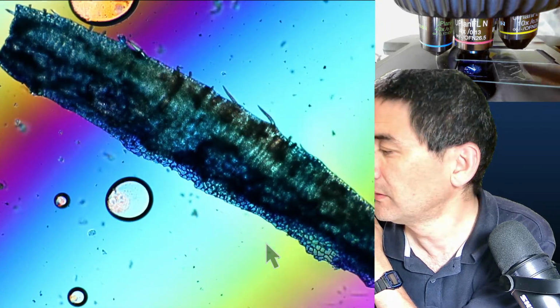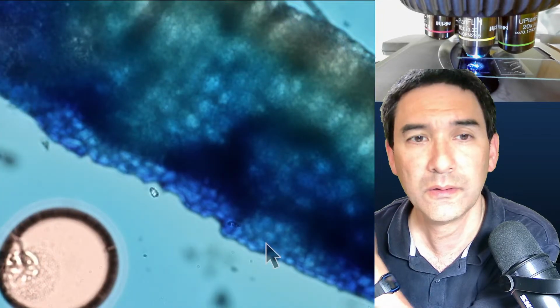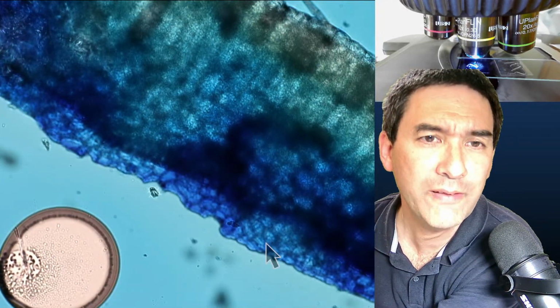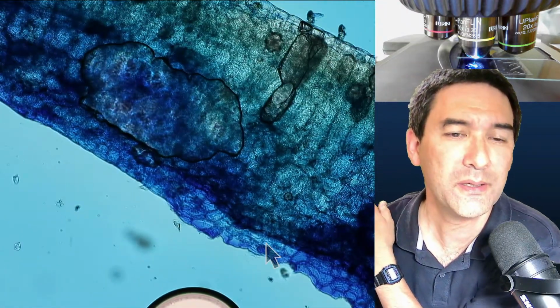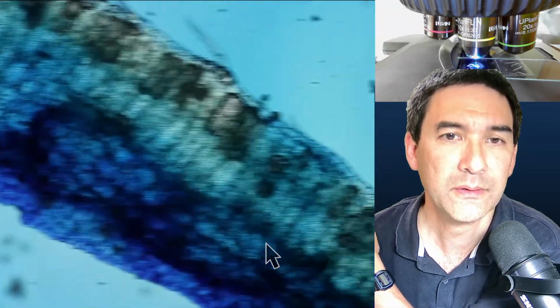Okay. And yeah, I don't know if this adds so much value to the whole thing. But sometimes the individual cells start to become a little bit more visible.